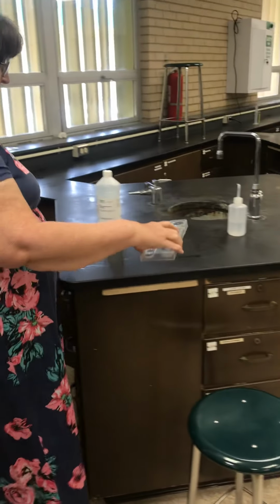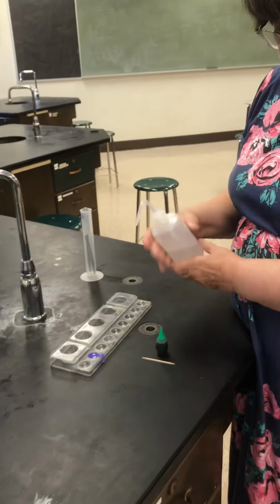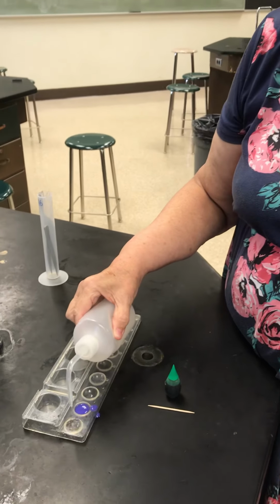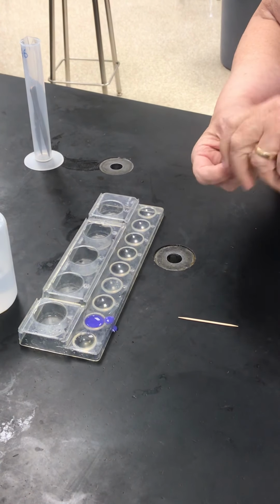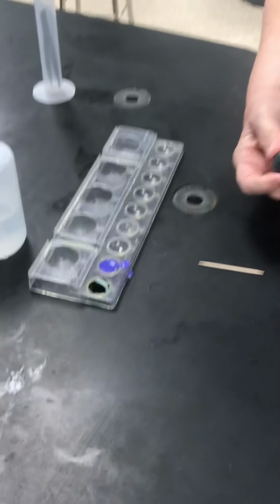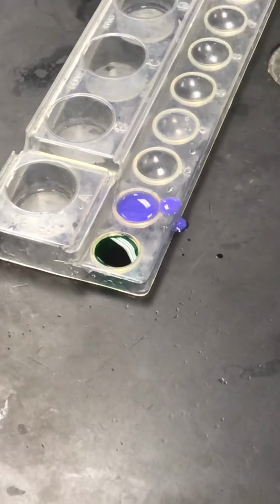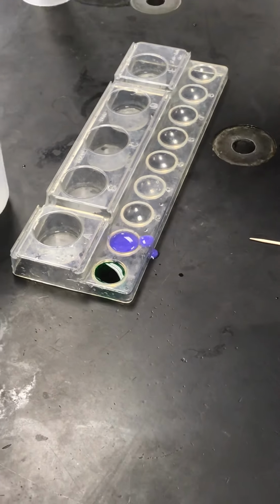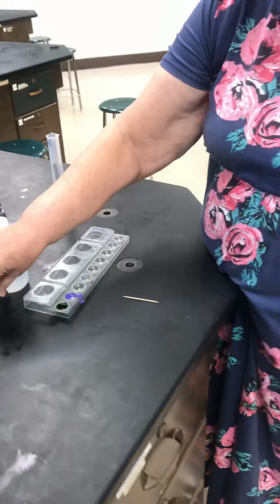So let's take our little plate over for a walk. And in this one, all we're going to use is water. Whoops, I made a mess. Water and one drop of food coloring. I chose green for Payson. It is green. You mean green with water made green? But pink and colorless make purple? Huh. Strange things that we do.